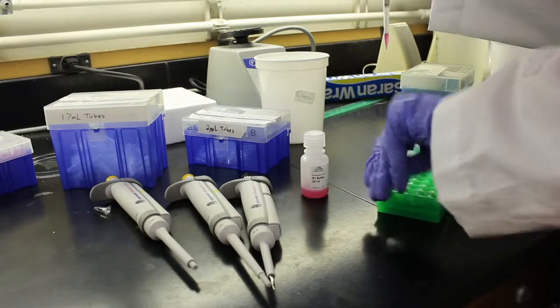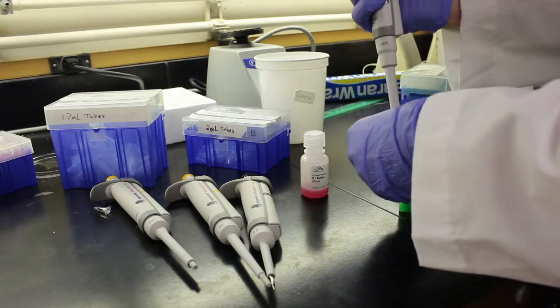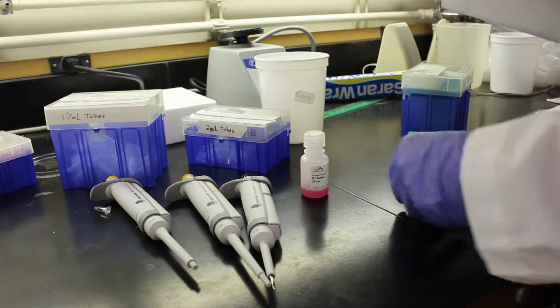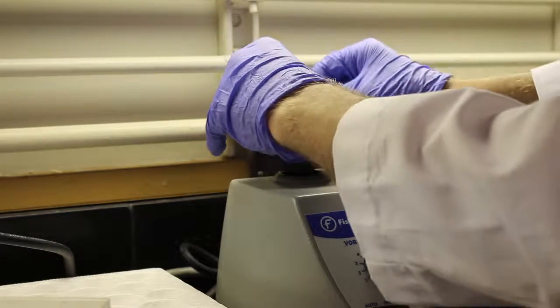Add 200 microliters of P1 buffer to each tube in order to resuspend the pellet. Mix by pipetting and/or vortexing the microtube.